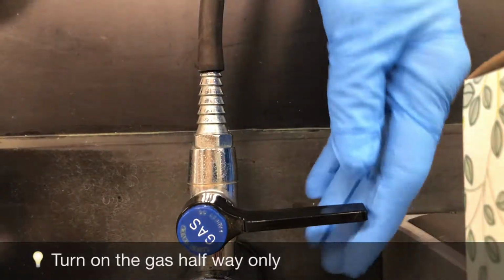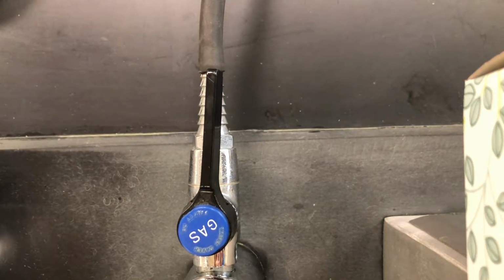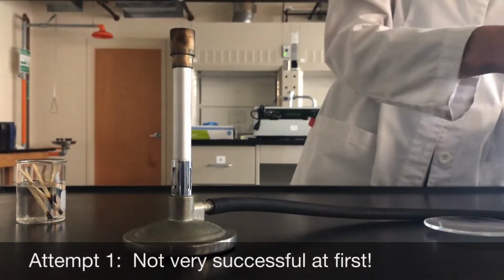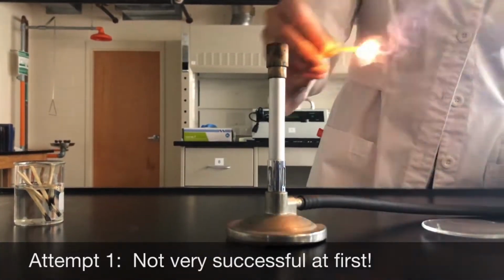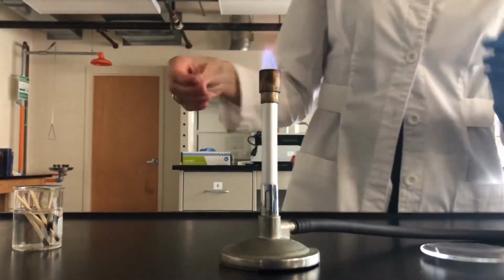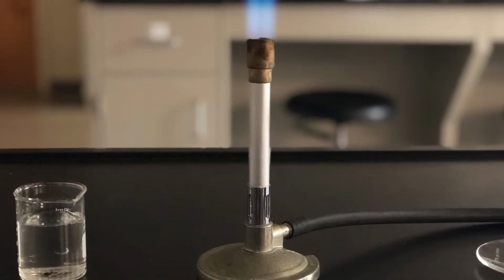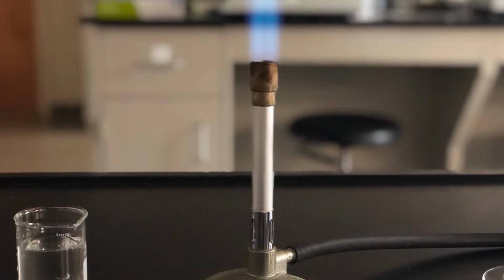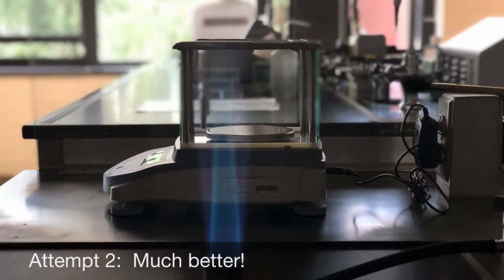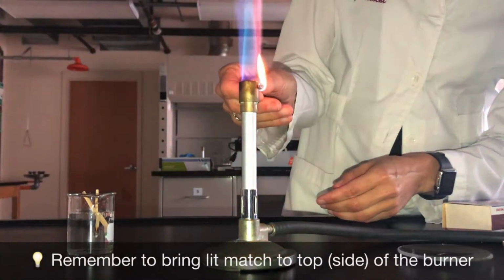Turn on the gas halfway. You'll know the gas is on by the hissing sound that it makes. Then you bring the lit match to the top side of the Bunsen burner.